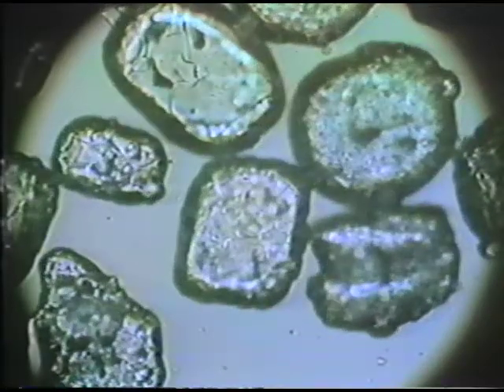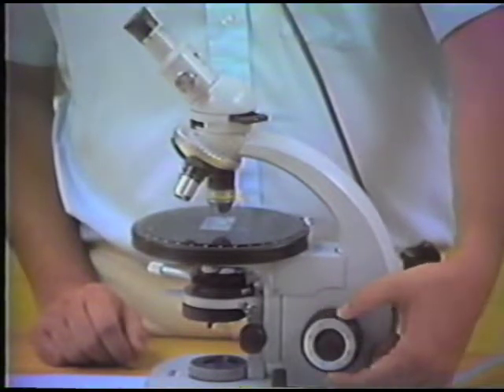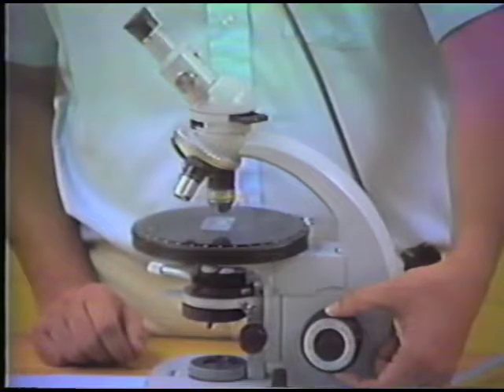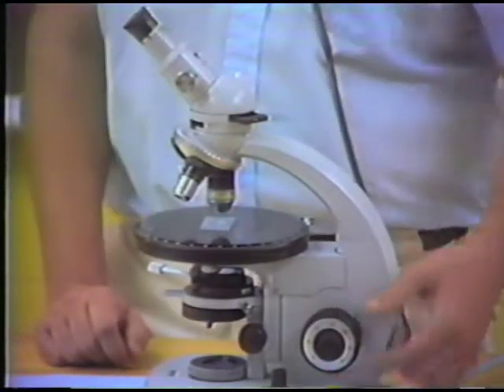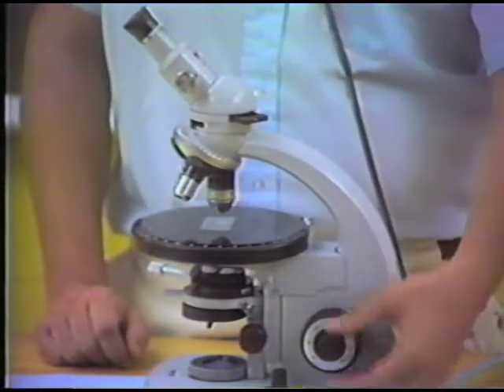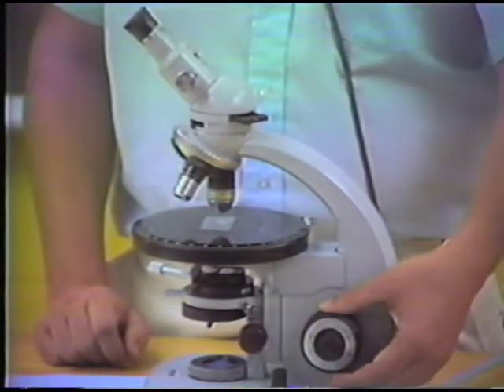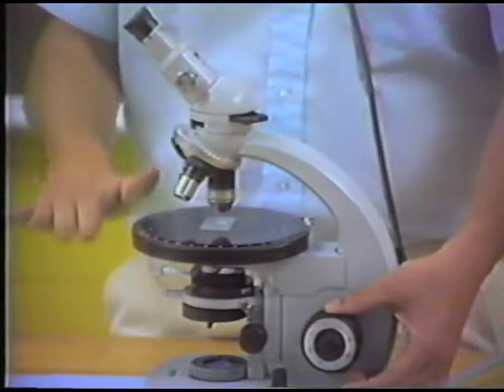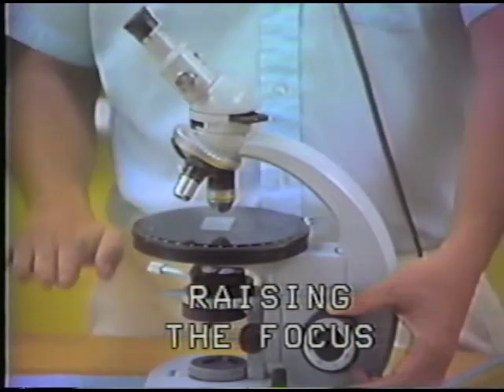That is, I want to move my focus so that the stage of the microscope has a sense of movement that effectively lowers the stage. The stage moves, and in some microscopes the tube of the microscope moves and then would be raised. So whichever sense you use, you want to think of either the stage being dropped or the tube of the microscope being raised. That is, you're raising the plane of focus of the microscope as you look at the specimen.